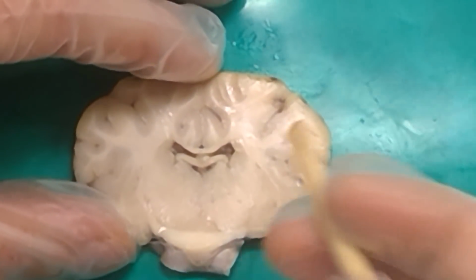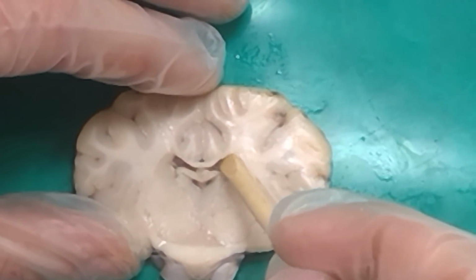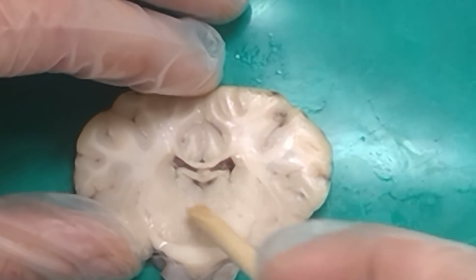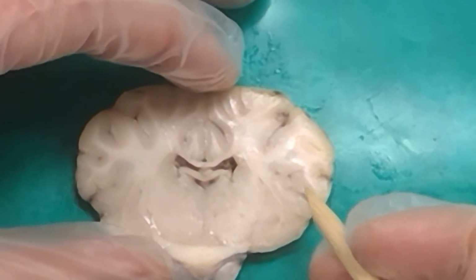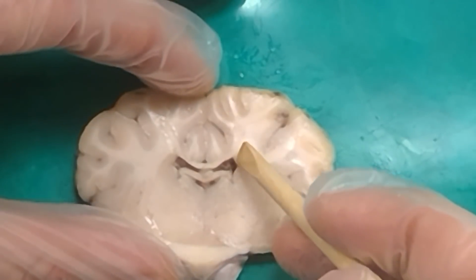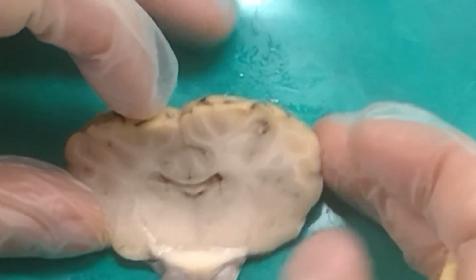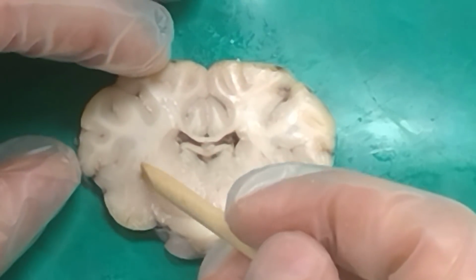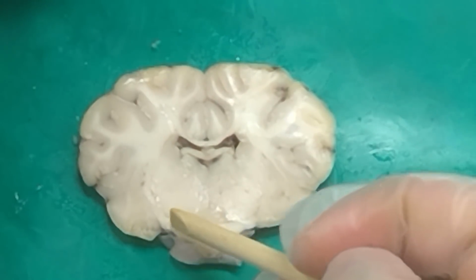All right, so from this side now, this gross black stuff hanging out inside here. Right, and these fibers right up here. Corpus callosum. And these fibers right here. Fornix, right. And then, let's see, so now what is this nucleus over here to the side? Caudate, right. And we can make out this teardrop shape over here on the side. Amygdala, right. So we no longer see the claustrum here.